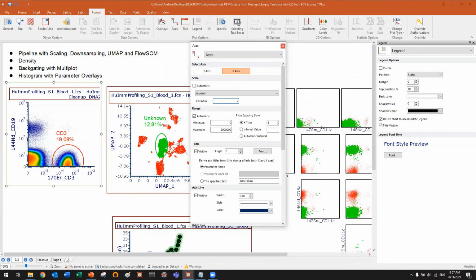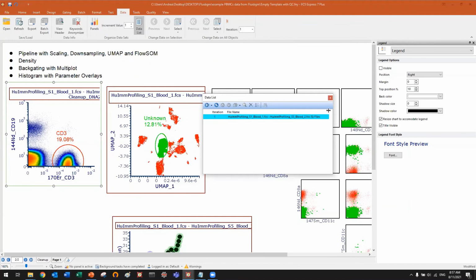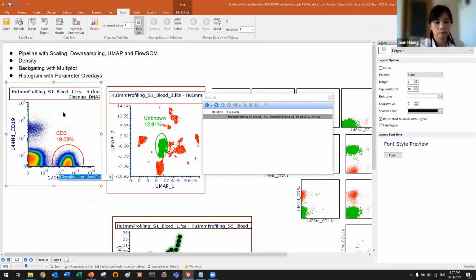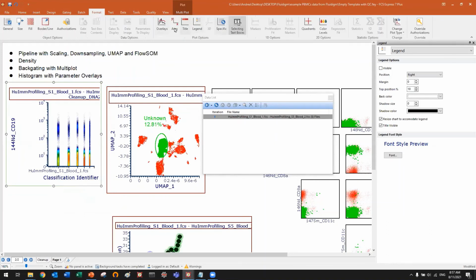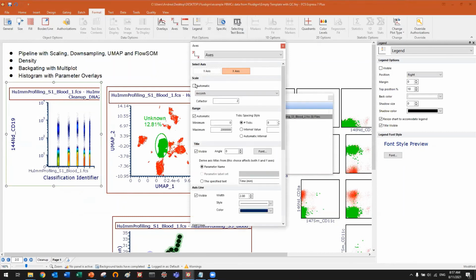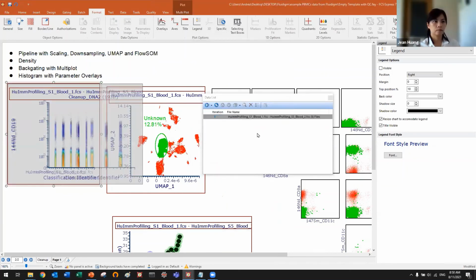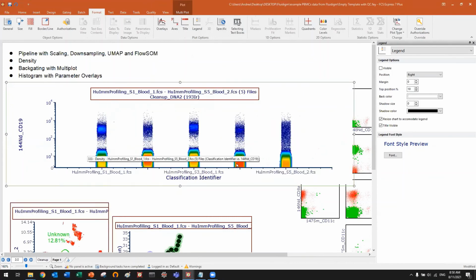And about how to specify which samples I want to include on UMAP or tSNE. So this is a great point, thanks for asking. In this case, I merged 5 different samples, and I can discriminate between the 5 different samples this way. If you see here, now I'm loading. Okay, let me go back to the automatic scale. In this case, we have 5 different samples merged together. Here we go. This is sample 1, sample 2, sample 3, sample 4, sample 5.